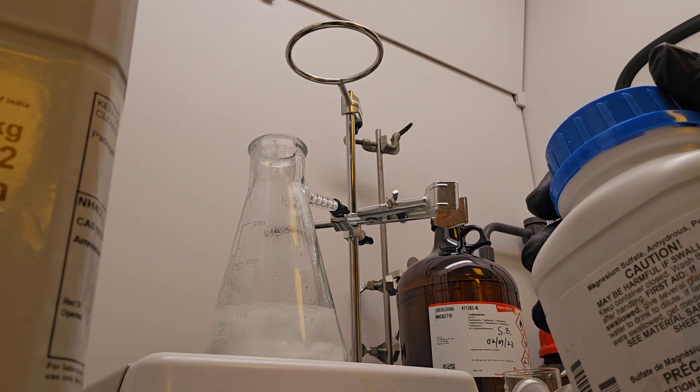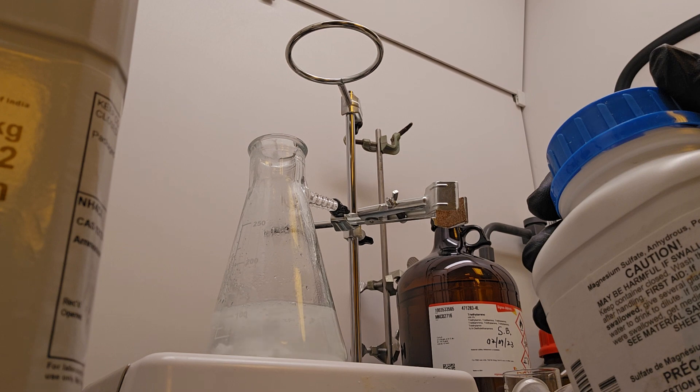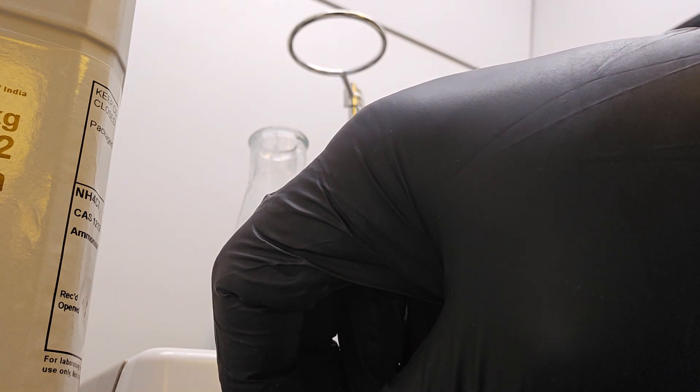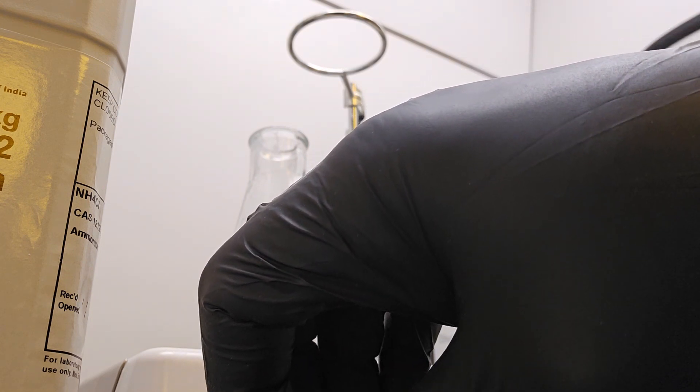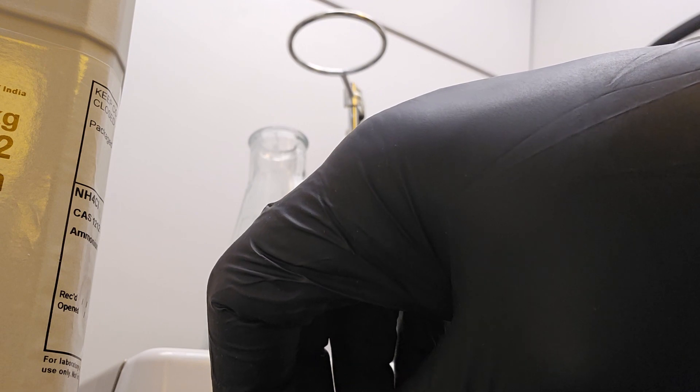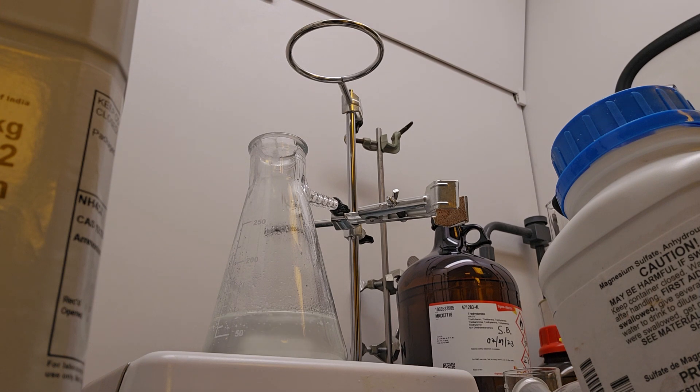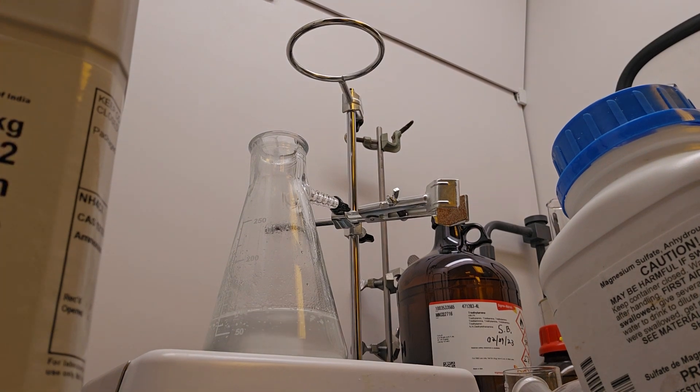And so I'm going to turn this stirring action down a little bit. Looks like we got one huge clump now. And our solution is actually beginning to clear up.